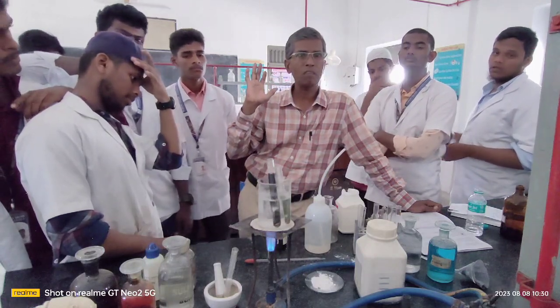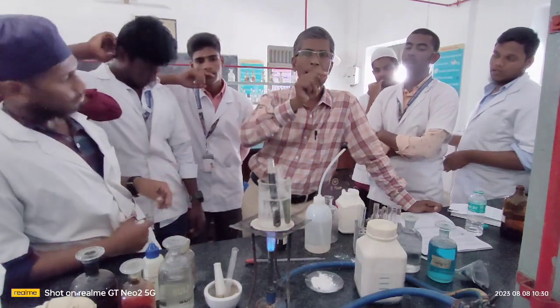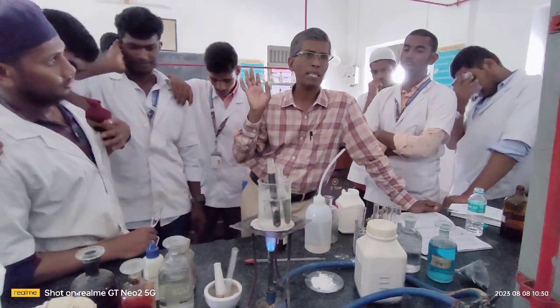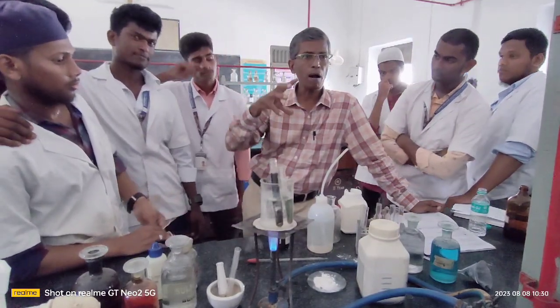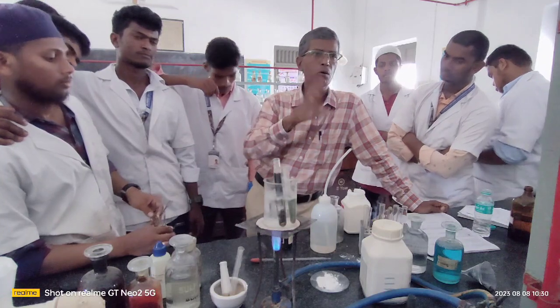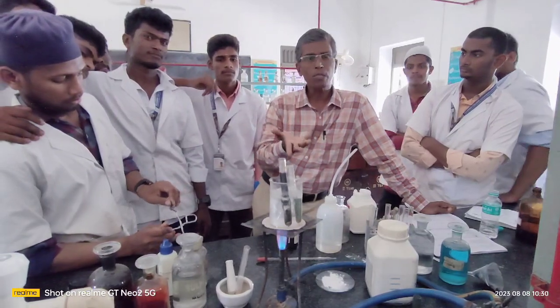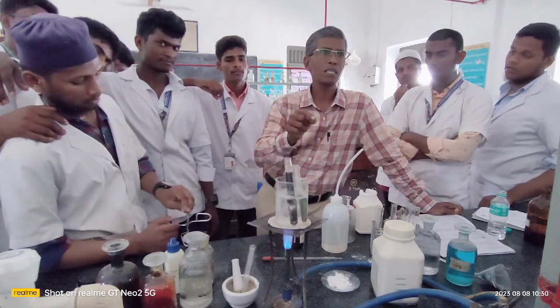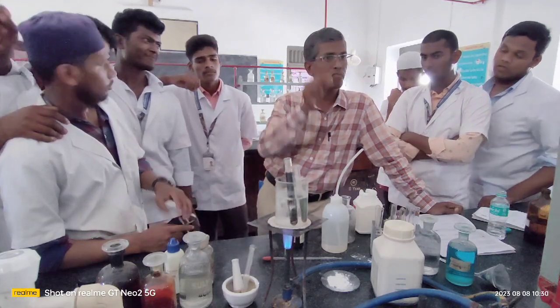Right? This is the procedure of starting your analysis of the organic compound, and I have explained how to write the procedure, and how to end up and close your write-up. And when you are in the examination hall, you keep all the confirmatory tests on the spot, in the test tube holder, and the examiner will definitely visit you, and may ask you to show the confirmatory test you have arrived at. At that time you have to show the confirmatory test and also explain the procedure you have followed. Okay.